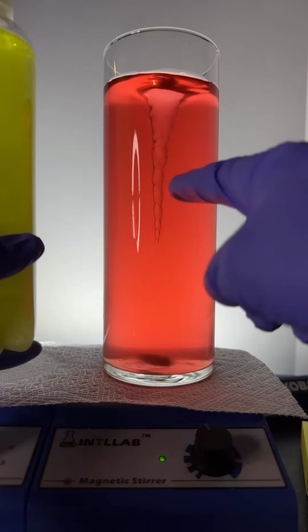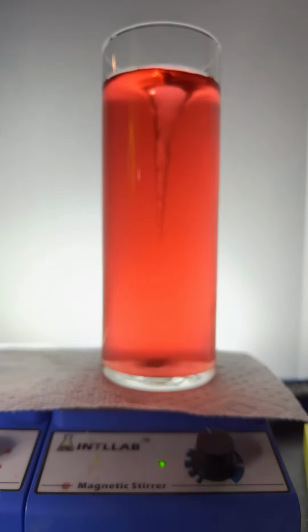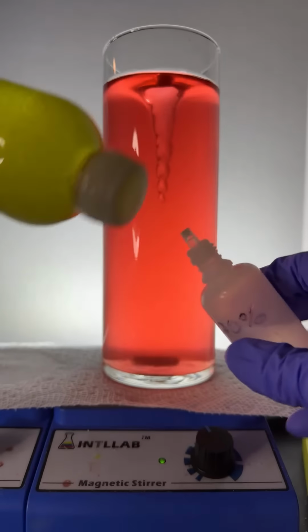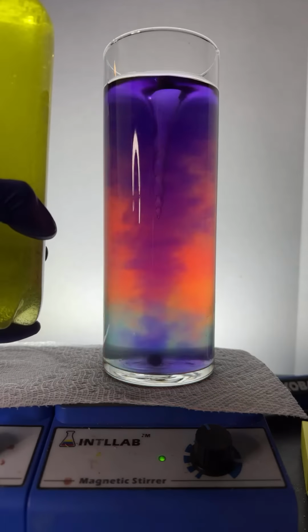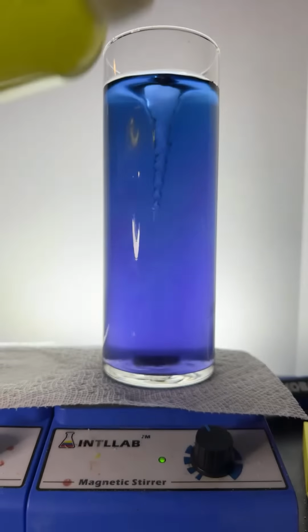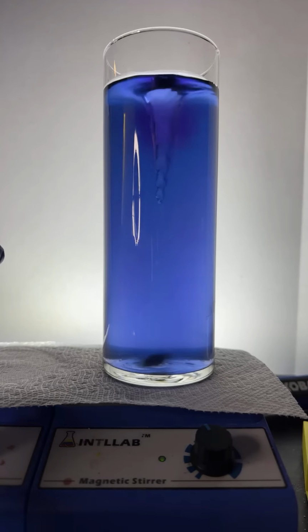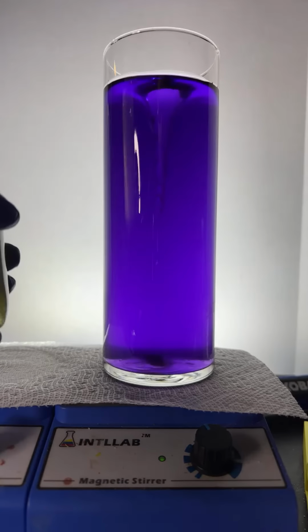Now, this, incredibly enough, has the same dye in it that this does. So watch what happens when I add some sodium hydroxide, which is a base, to this thing here. A couple drops. You can see, when you add a bunch of drops, you see a flash of the rainbow. But when you add base to this particular dye, it goes blue. If we add a little more, we'll get it to go violet. All right? So violet is as far as we can go on the base end.